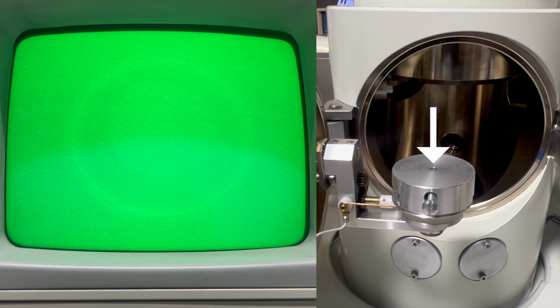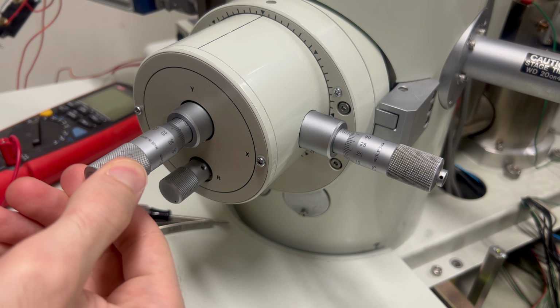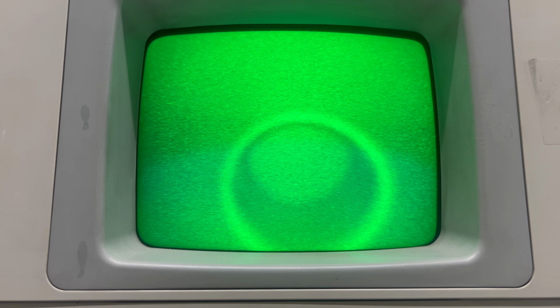Wait a minute. That circle might be the center of the specimen stage inside the chamber. Hang on a second. Let's move the stage and see if anything moves on the screen. Okay, I think that might be the stage on the screen. It looks like it moves as I twist the micrometer knobs. Okay, well, that's definitely promising. What if we zoom in a bit?